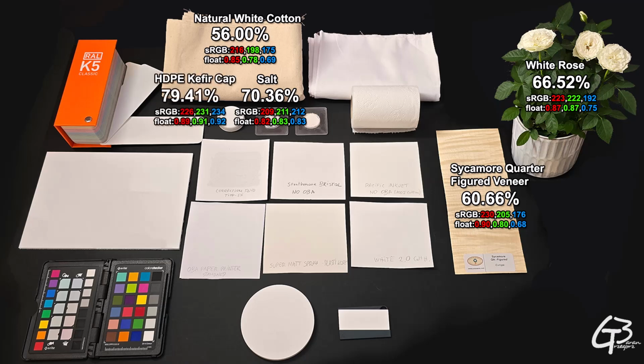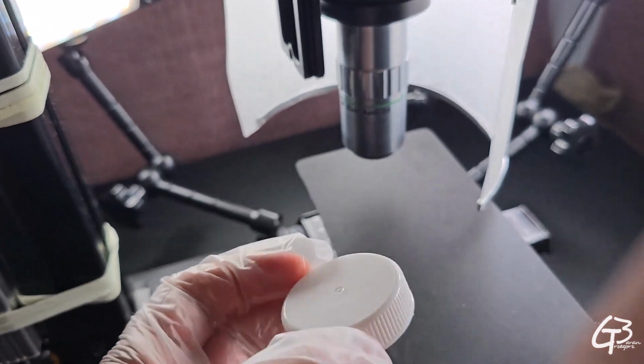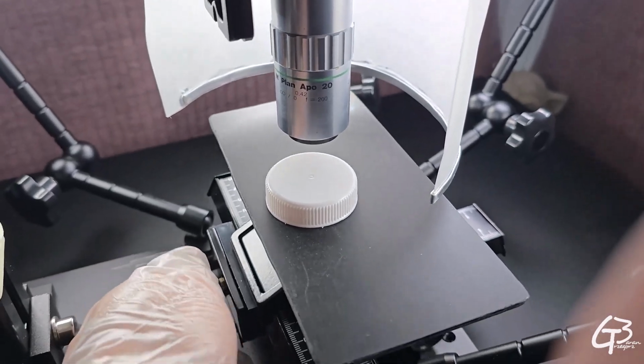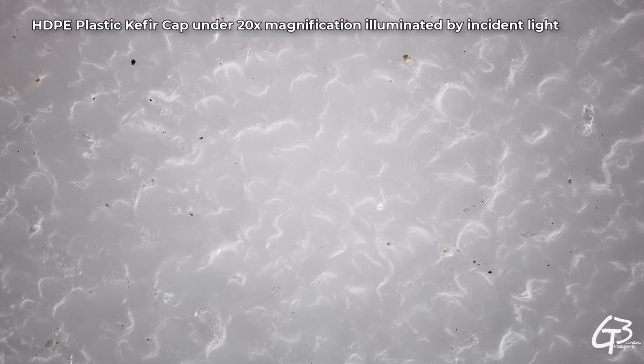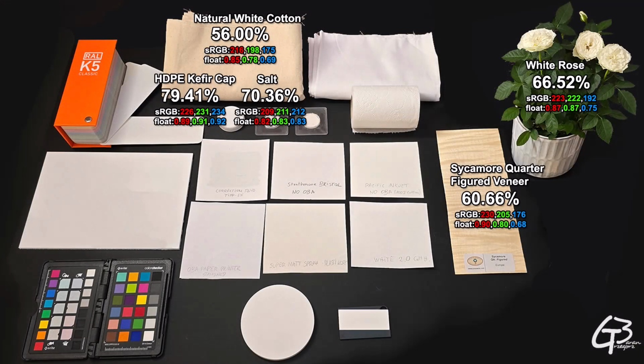The substance of HDPE plastic is almost 10% whiter than salt and reflects almost 80% of the light. 80% of reflectance is definitely in the luminance area, which falls into the white category. When magnified, the substance doesn't look like the previous organic translucent ones anymore. It's solid and certainly translucent, but not very reflective. The contact surface looks quite irregular compared to what I expected. I guess this bumpiness makes it matte. This plastic cap absorbs slightly more reds than blues, therefore its color tone shifts slightly towards blue.